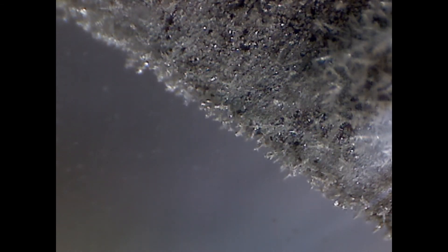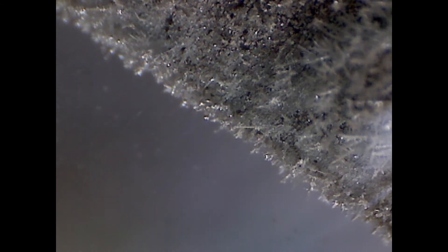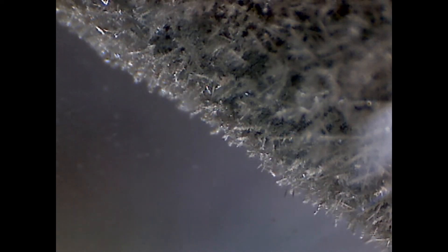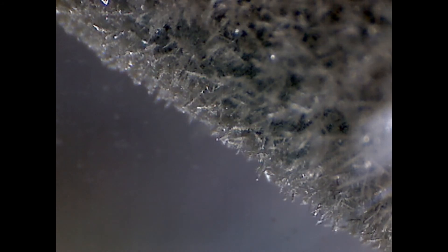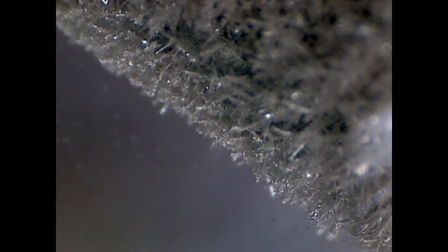Here is another example. Under a microscope you can see a small piece of copper which has been dipped into silver nitrate solution. In this case copper is the more reactive of the two metals, and you can soon see tree-like crystals of metallic silver appearing on the edge of the piece of copper.